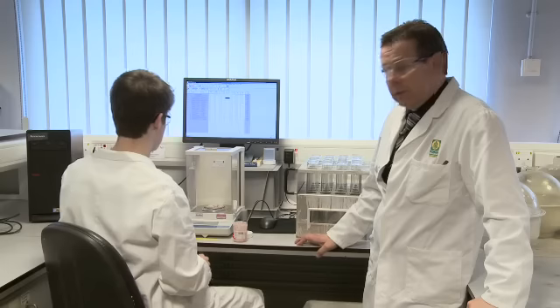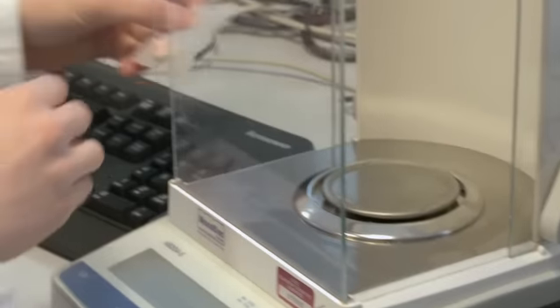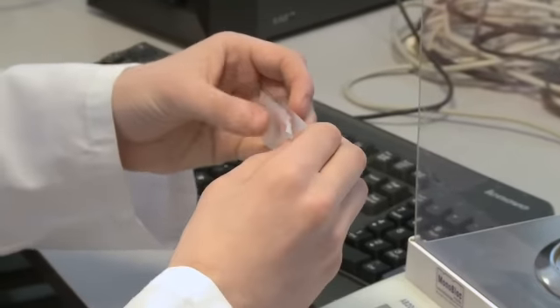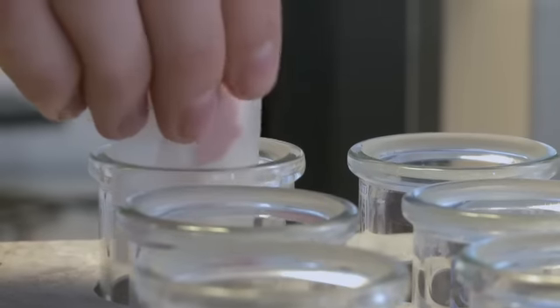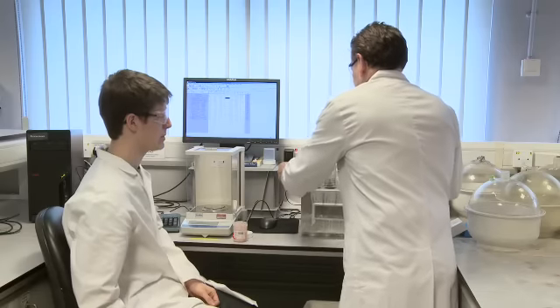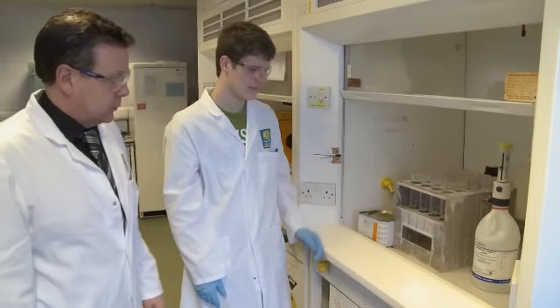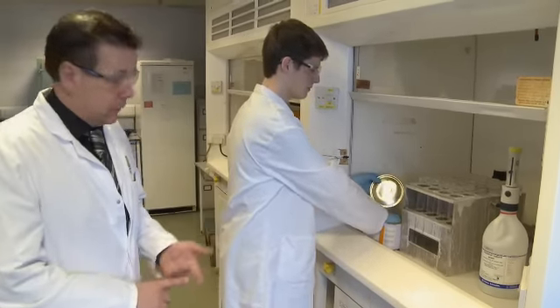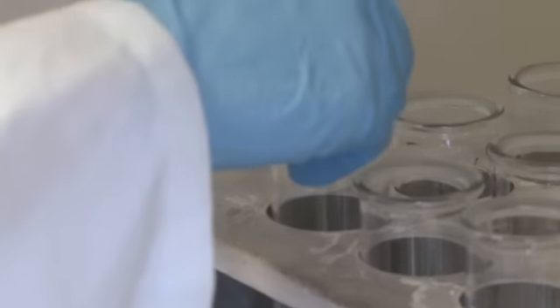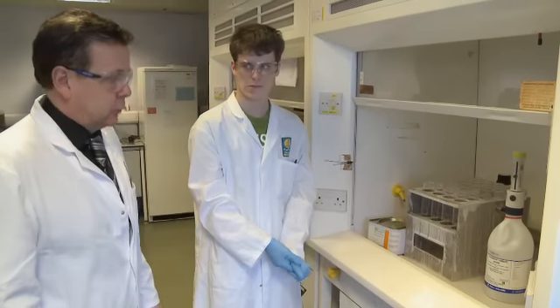The combined sample and paper is transferred to the digestion tube, awaiting the next digestion stage of the process. We are now going to add the catalyst tablet to the sample. The catalyst tablet consists of a mixture of potassium sulfate, copper sulfate and titanium dioxide. The catalyst itself will aid the reaction to progress.